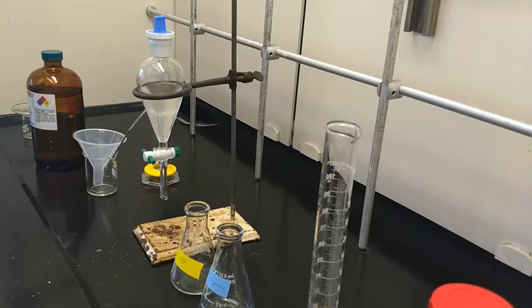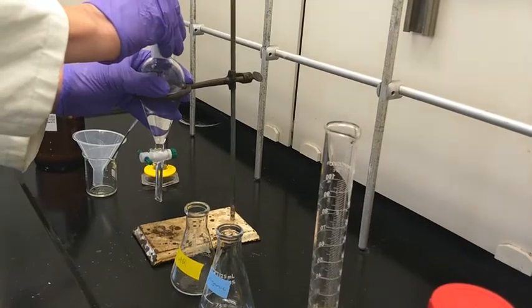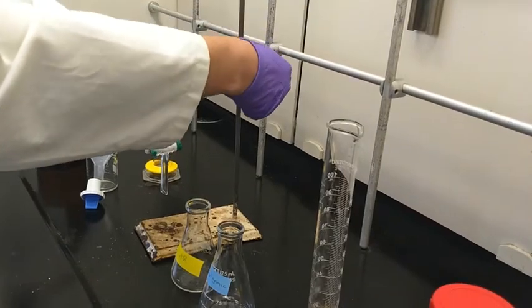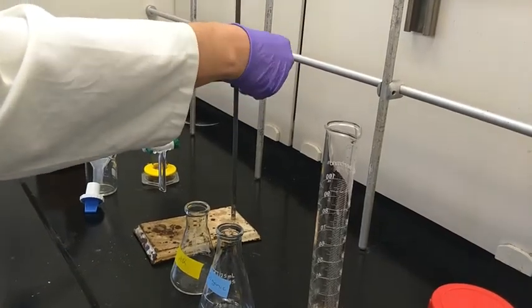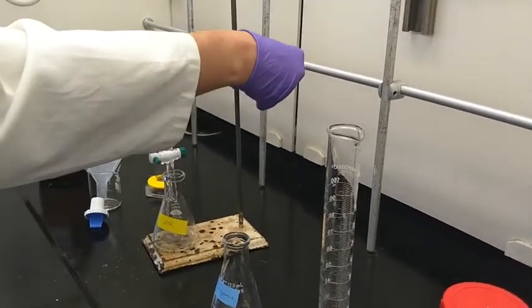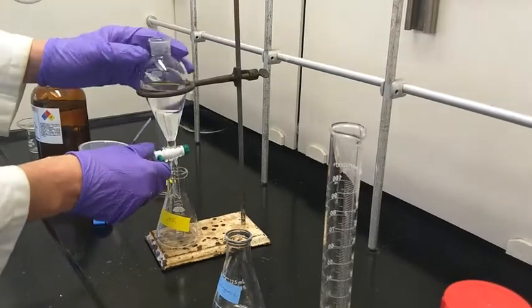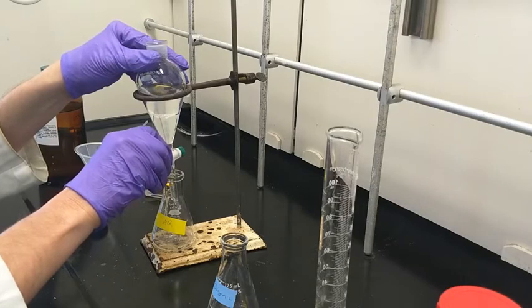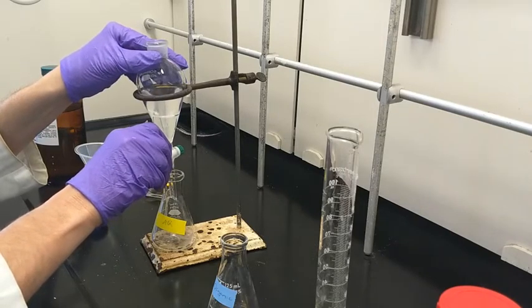After you've agitated enough, put it back in the iron ring. Some people try to use an extension clamp — it's not practical, it'll fall out — use the iron ring. You'll probably see the layers form roughly in the middle. Now I'm going to take the stopper out and set up the receiving flask. I like to use color-coded flasks to make it easier so you don't get things mixed up. Have the opening below the neck so as it comes out it doesn't splatter.